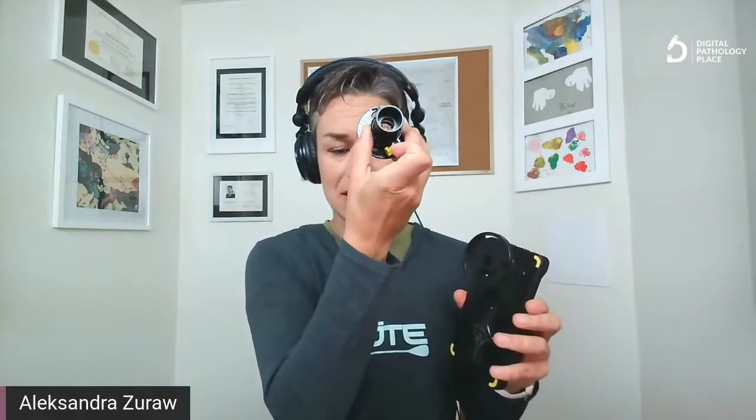Basically, this has a little attachment to the case that it lives in, and then it has an eyepiece adapter. The important thing is, because I tried many of those cases from Amazon where you just take your phone and attach it with some screws, very disruptive to the workflow and it doesn't really hold the phone. And then I found out about this thing that has this eyepiece adapter.